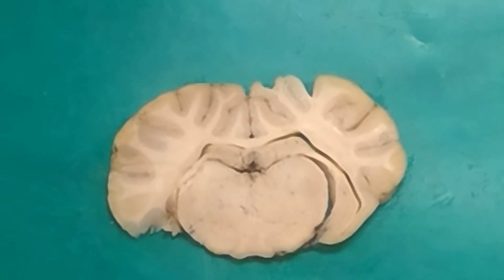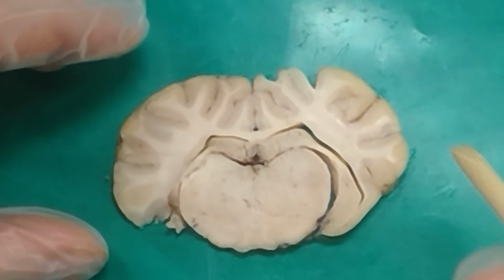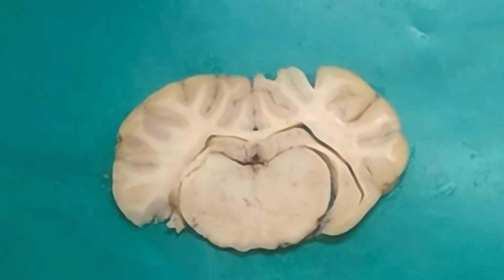Yeah, so you won't see fimbria unless you can see hippocampus at the same time, where you see it on the top and the bottom, because the fimbria is like the webbing of my hand right here that's connecting that top and bottom part of the hippocampus. It's like the white matter that's connecting those top and bottom parts so they can speak to each other a little bit more easily. It might have been kind of far back and we need to go back to it.